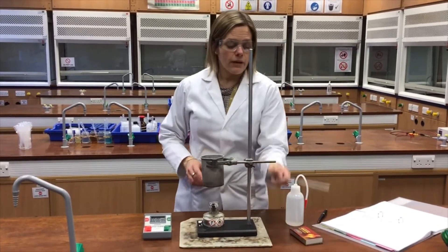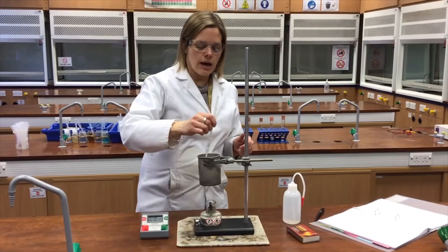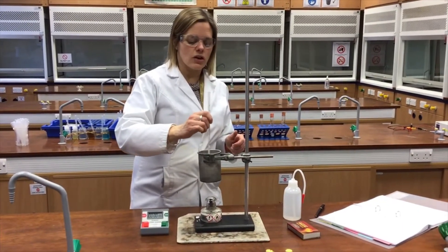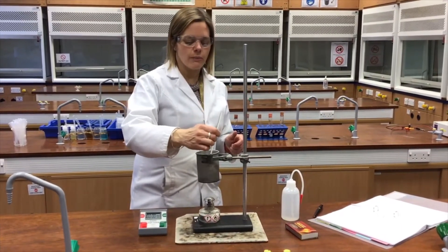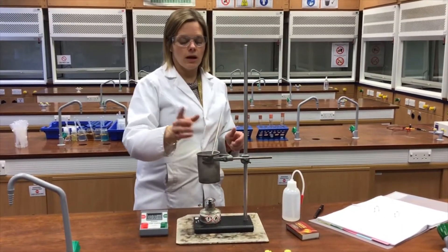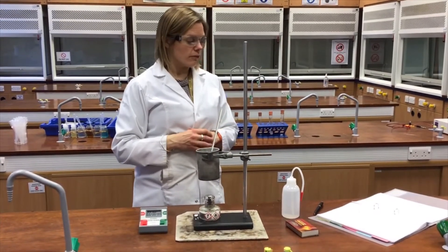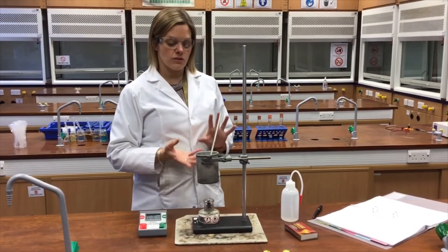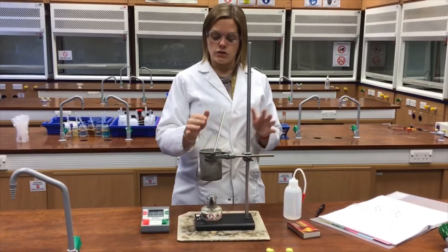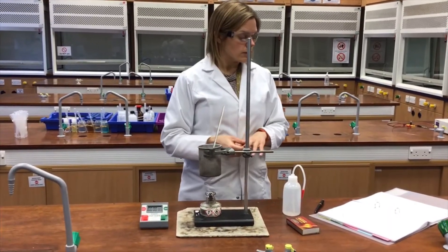I'm going to pop a thermometer into the water and give it a little stir, leaving the thermometer sitting there for a few moments whilst I record the start temperature once it has had time to adjust to its surroundings.